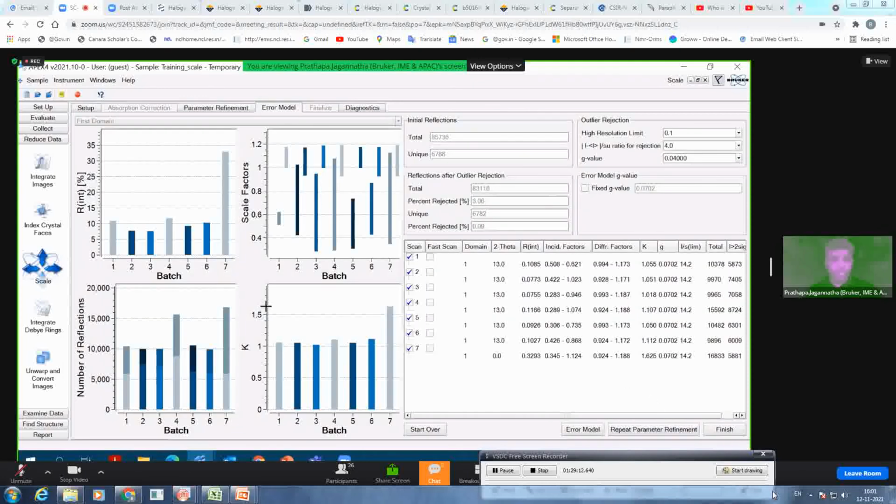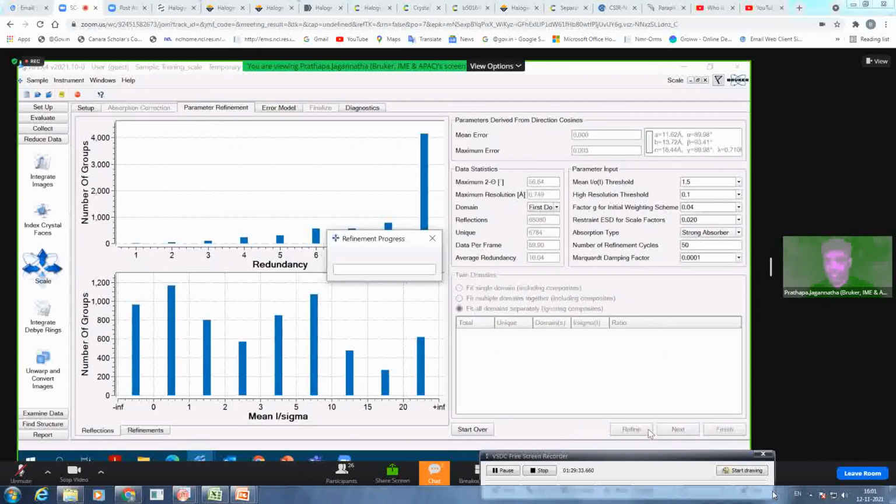So go to next. Now look at this, your R internal for all runs is good. For the seventh run, it is quite high, around 30%, while the rest are all around 10%. Why? Because this is a fast scan, so it is not considered. To involve the fast scan in your scaling, I just click here on the seventh one, and then I repeat the parameter refinement, and we'll see whether it has an effect on overall R internal and on mean weight as well. I was having 0.7 before, and then 0.72 it came up after restraining my scaling. So I want to see whether there is still further improvement.